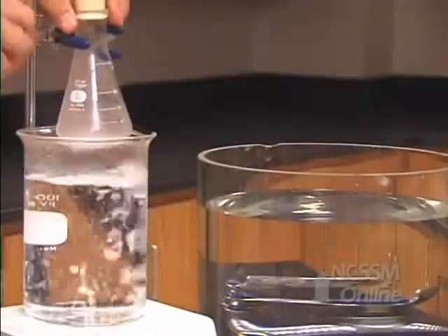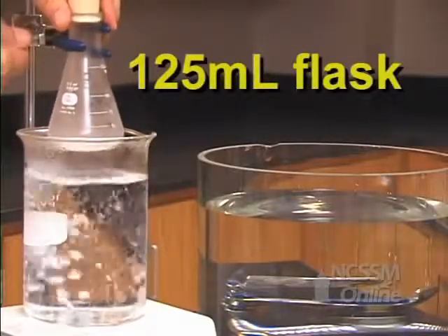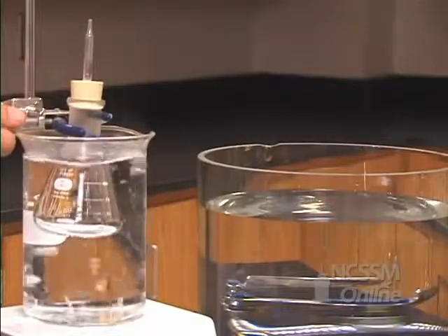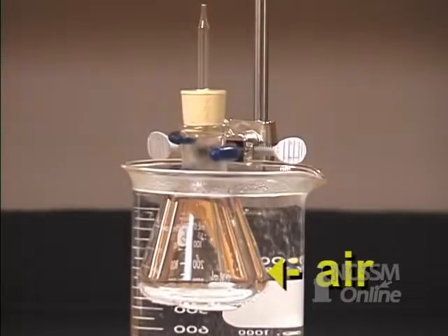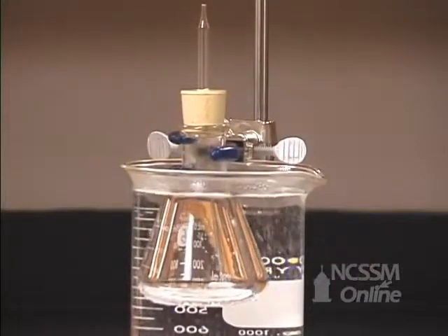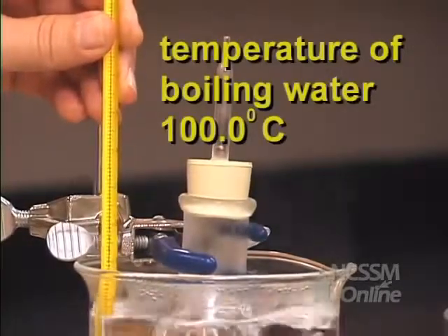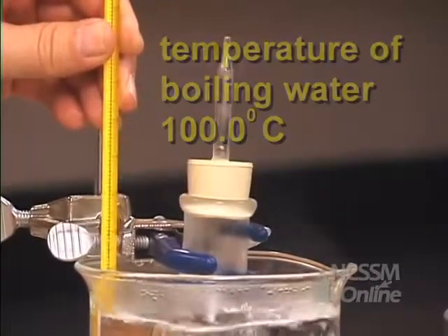We will take the 125 milliliter flask and place it in a boiling water bath. We will wait for a few minutes so that the gas inside the flask reaches the same temperature as the boiling water bath. The gas inside the flask, which is air, will expand as it's heated. When the air inside the flask comes up to the same temperature as the boiling water bath, there will be just enough air in the flask to fill the flask at the boiling point of water.